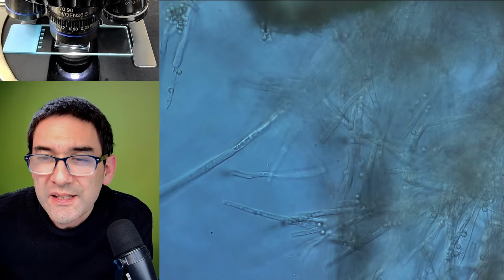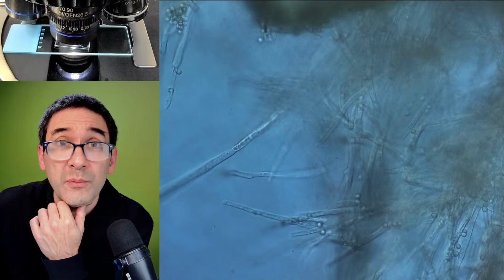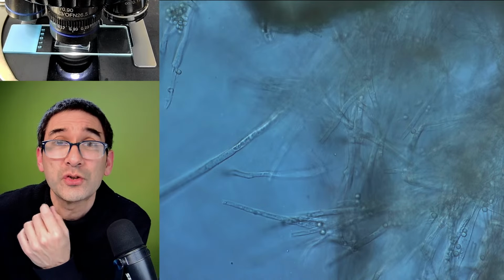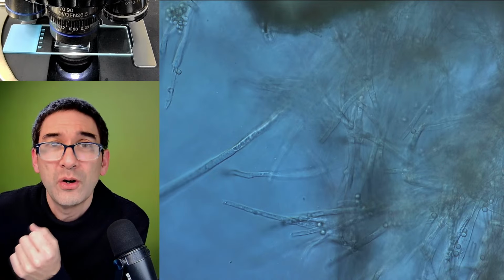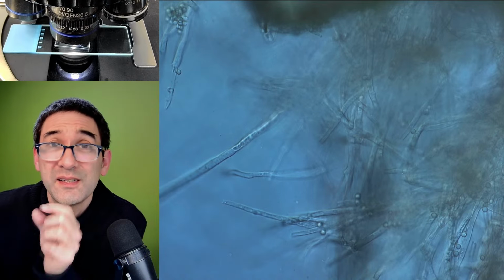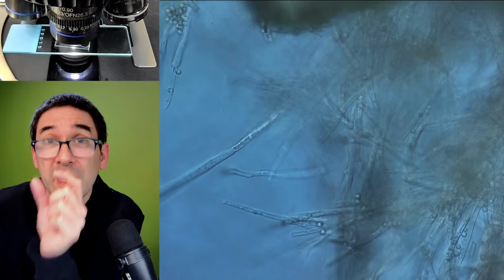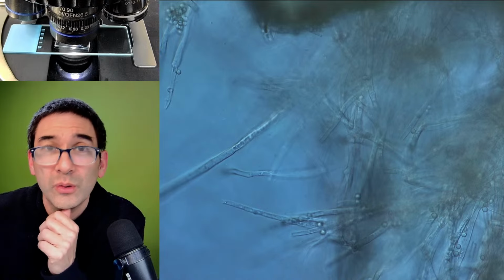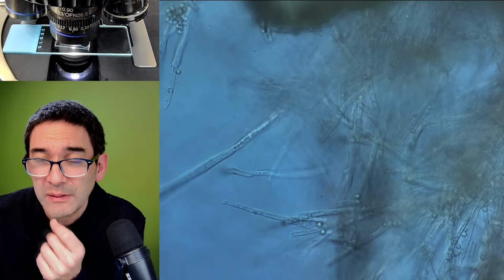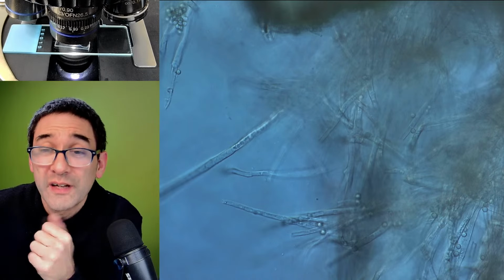Please also include a seed to look at up close. Yes, and this is something that I want to do. Indeed, some years ago, I've actually done a time lapse of seed growth under the microscope. As a matter of fact, the seed roots were growing so quickly that you could actually see them grow under the microscope. It's pretty cool. Especially with fast-growing plants, you can observe them as they grow.